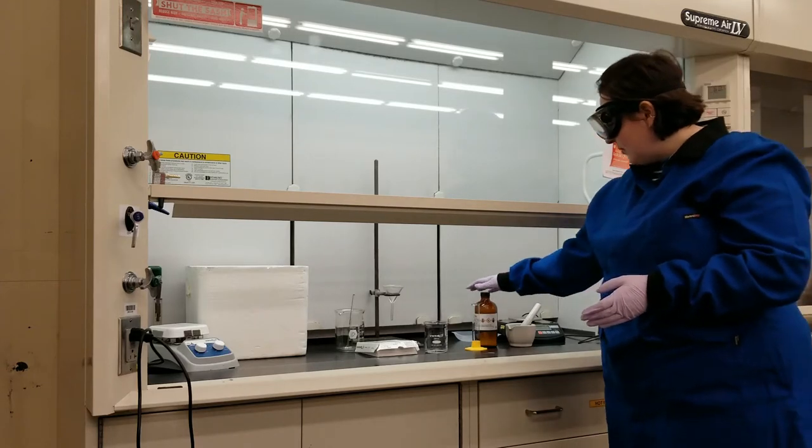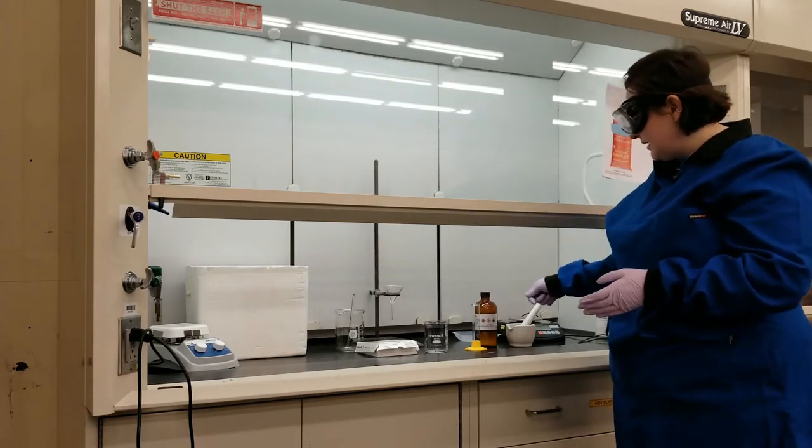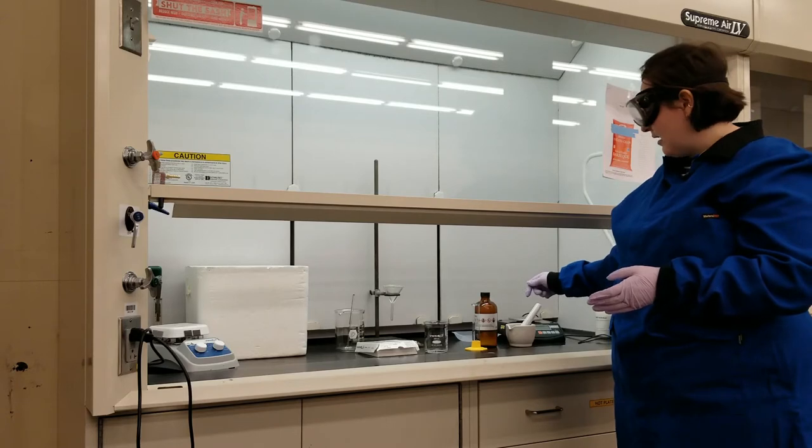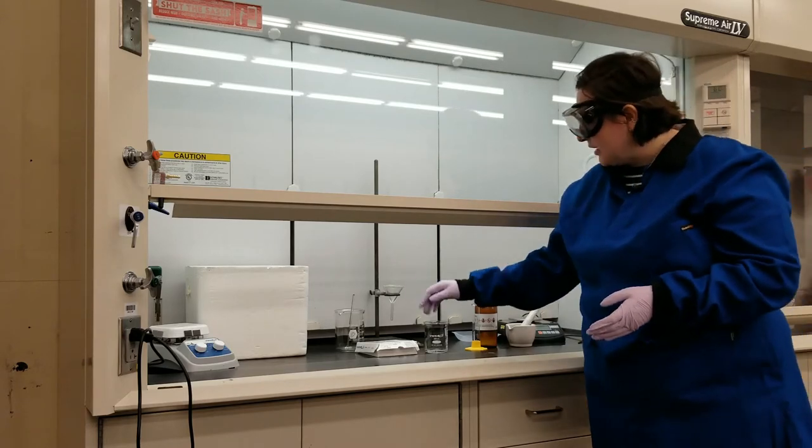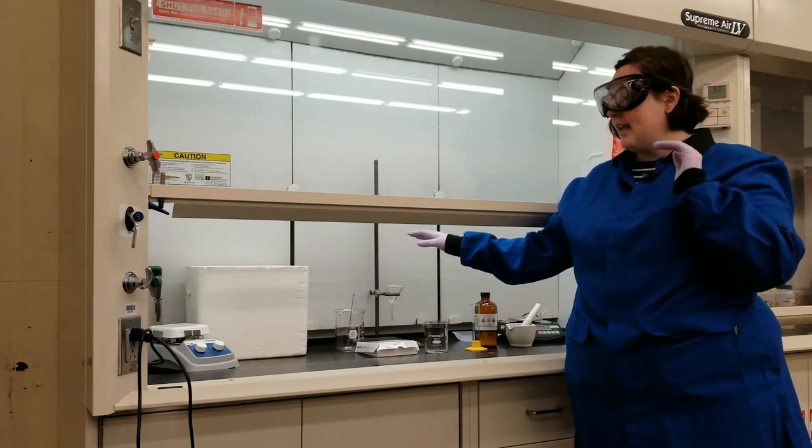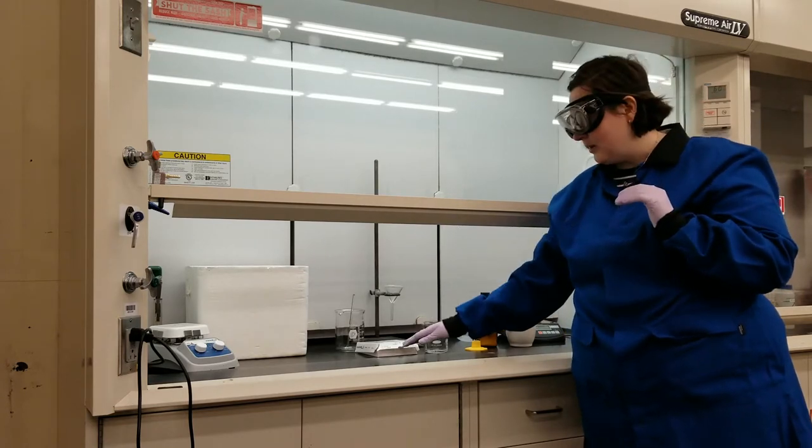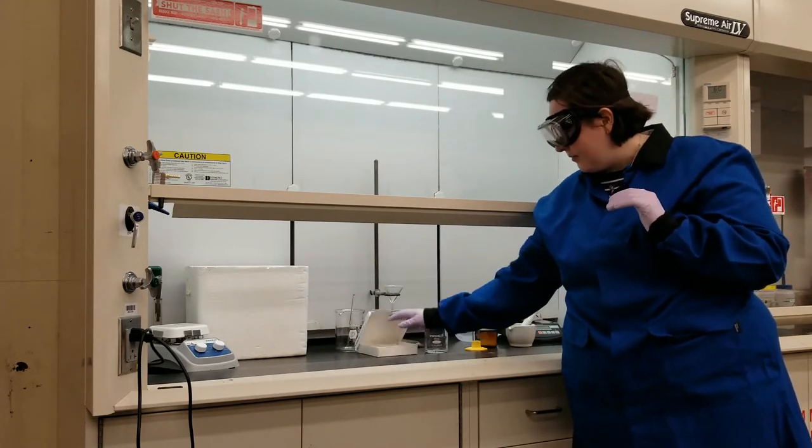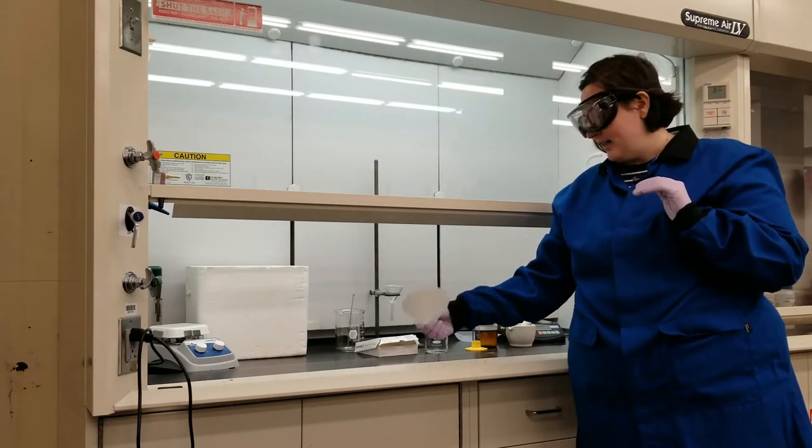When I am done mixing my fats and my potato chips and my hexane, I'm going to use a filter apparatus to separate the dissolved fat and the hexane from the chips, so I'm going to use a filter paper and a filter apparatus to do so.